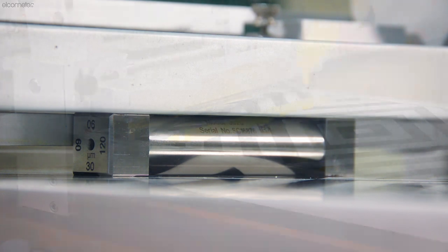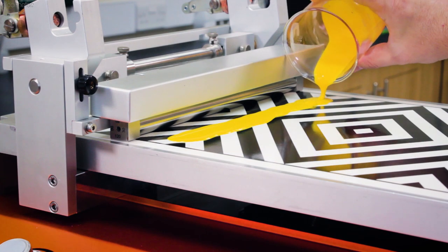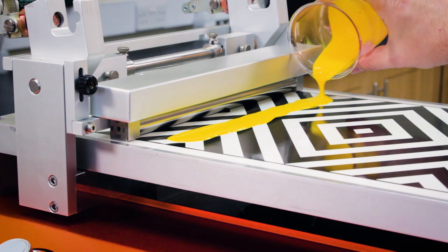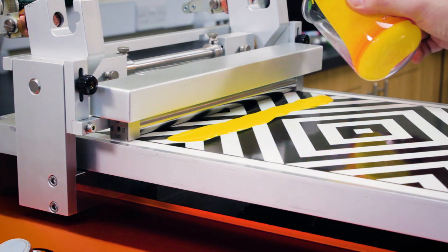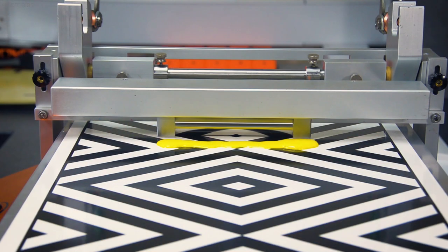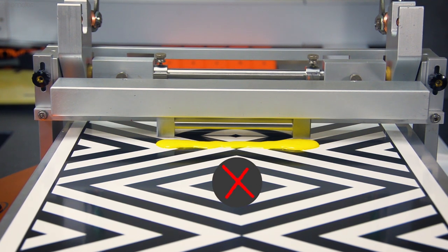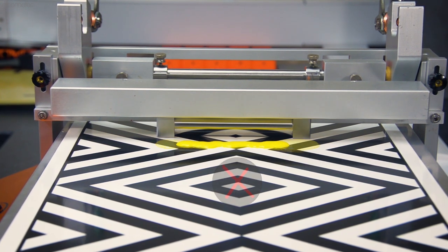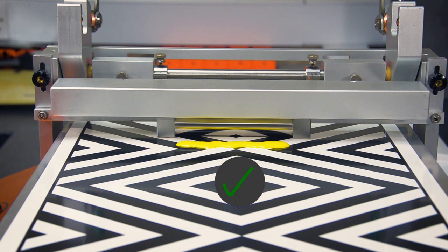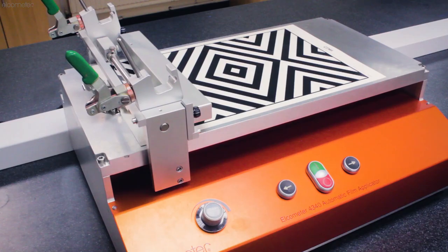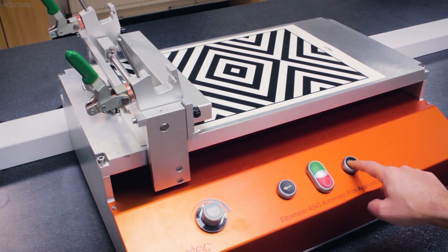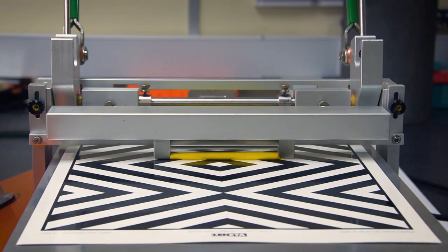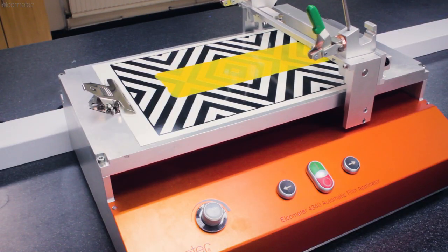With your applicator in place, pour your test sample in front of your chosen tool, ensuring it's evenly spread across the width of the applicator. Try to avoid getting your product in front of the feet of the applicator if the one you've chosen has them, as this can cause the applicator to become uneven and affect the consistency of your film. Then with the machine on, press the carriage start button and your film is created, with the carriage stopping automatically at the stop position.